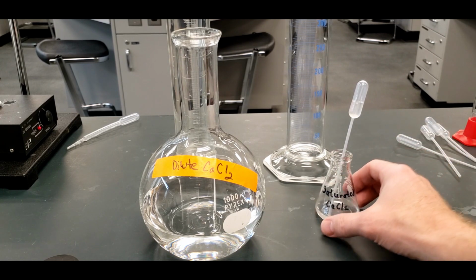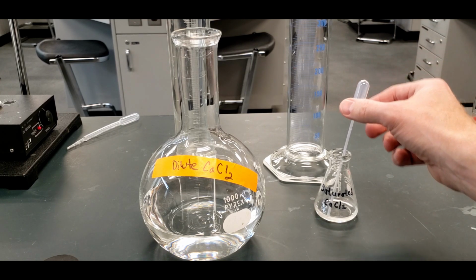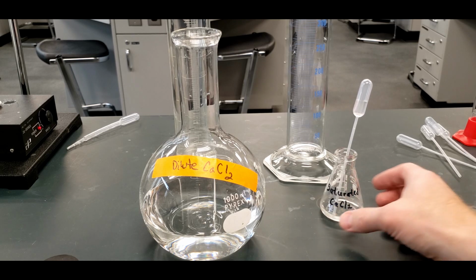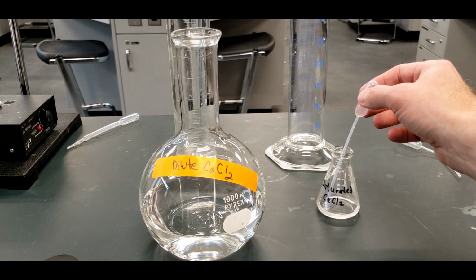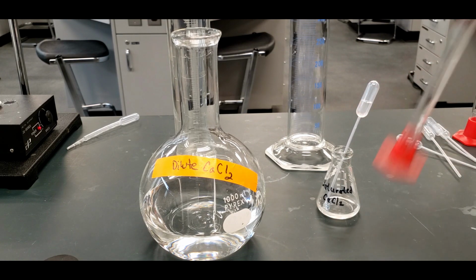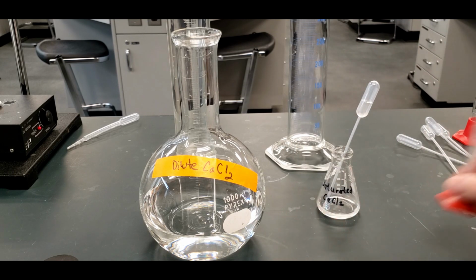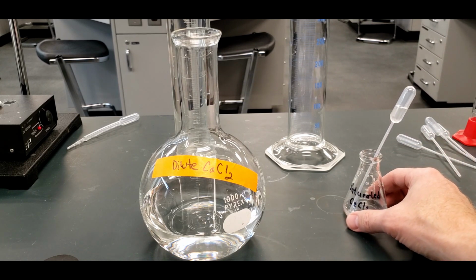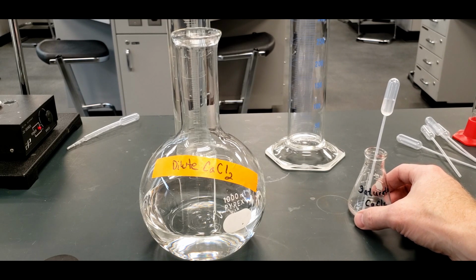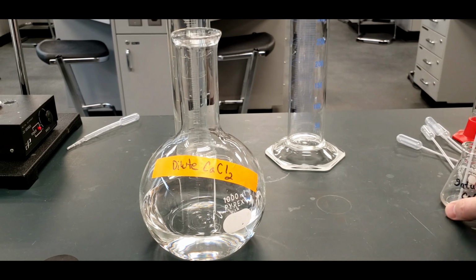This is how these work. The size of this pipette gives off about the same size droplet. You just have to determine what the volume is, and I'll tell you what that is at the end of the lab. Normally you take the solution and put it into something like a graduated cylinder, fill it up to the 5 mil mark, and count how many drops it takes. Then you determine the volume of each drop. Again, they're within a percent of each other, so if we know that average volume of each drop, we're fine. But we'll worry about that later. I'll put that data for you, the volume per drop.